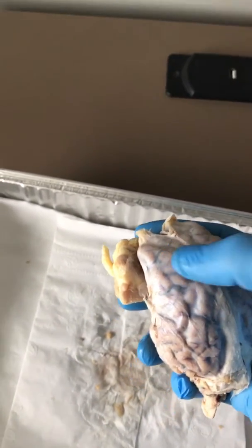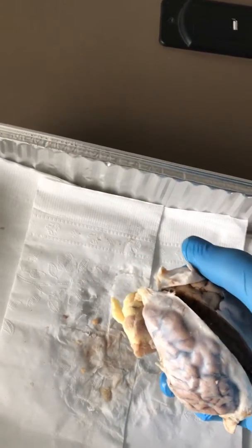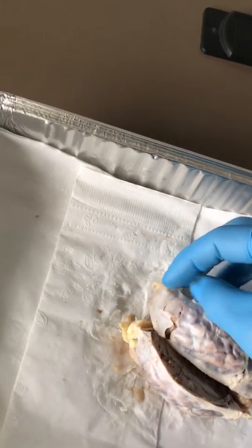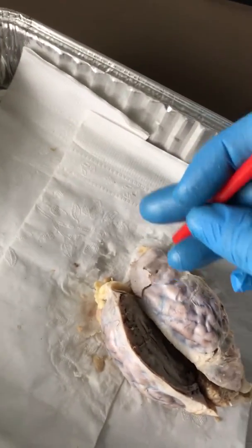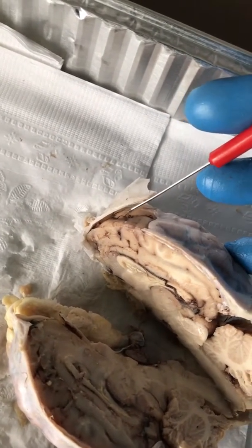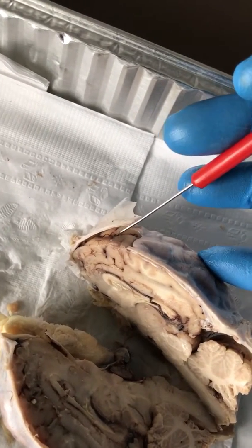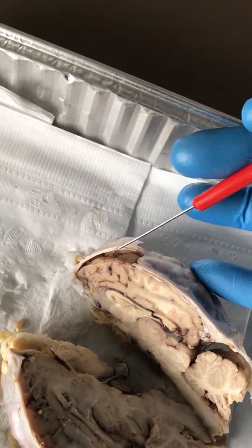So, we've got the sheep brain here. The cerebrum is in this area up here. And as you can see, I've exposed some of the meninges to get to the actual gyri and sulcus. So in here, you'll see that these big raised bumps right there are the gyri, and the channels that run between them that are darkened here that have blood vessels are the sulcus, or gyrus and sulcus.